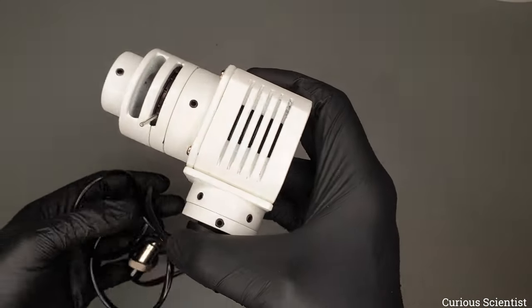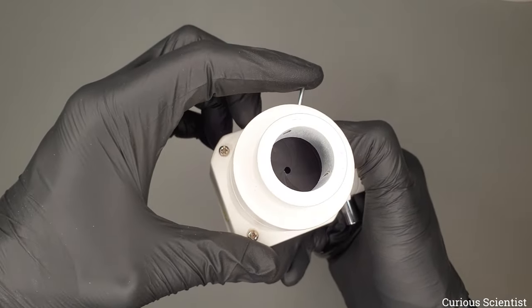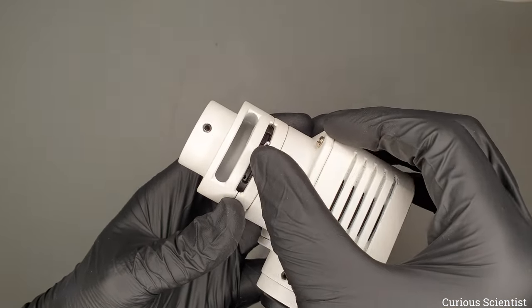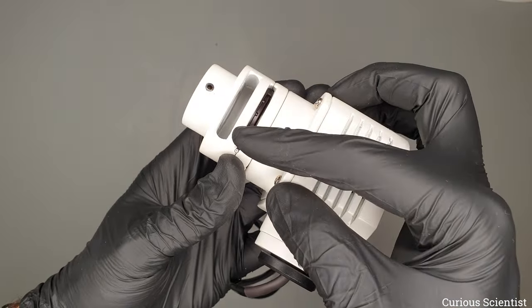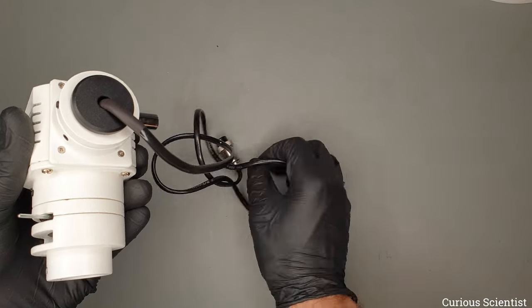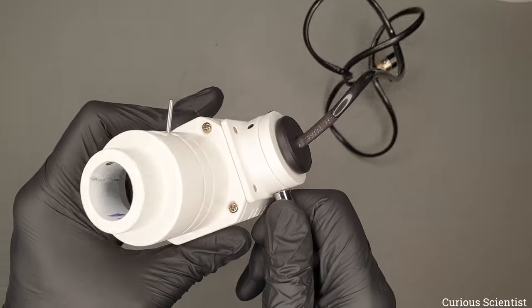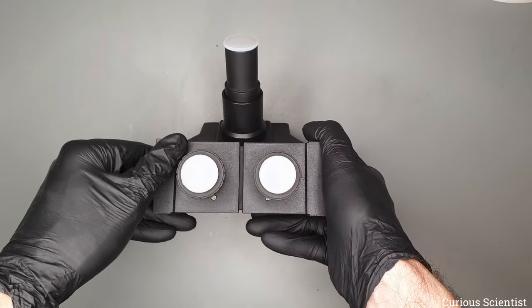The lamp house connects to the power supply. There is an aperture inside, and with the help of a small metallic arm I can adjust its diameter, which controls the diameter of the light beam reaching the specimen surface. Manipulating the diameter also changes brightness: a narrower beam means less brightness and a broader beam means more brightness, which also affects image quality.